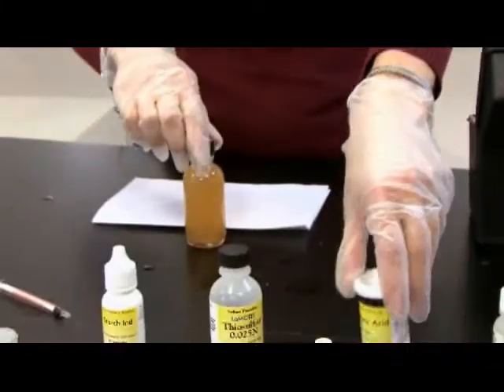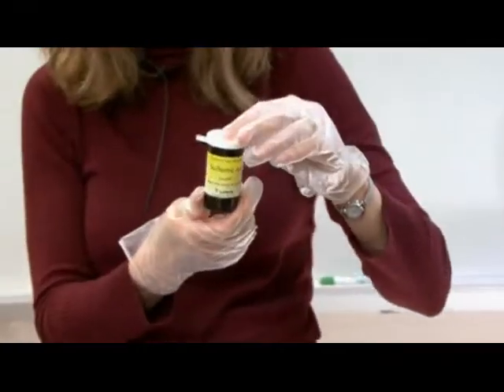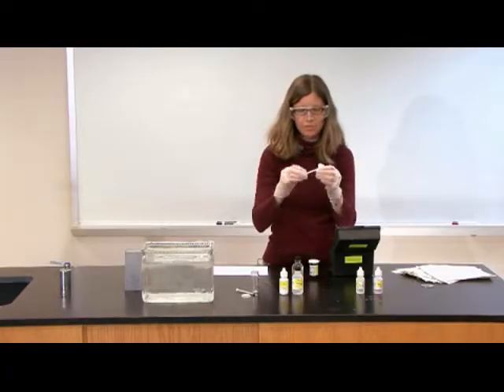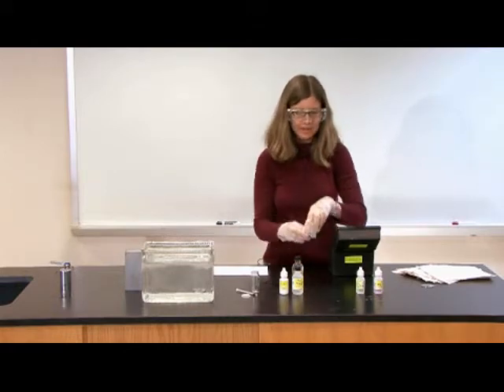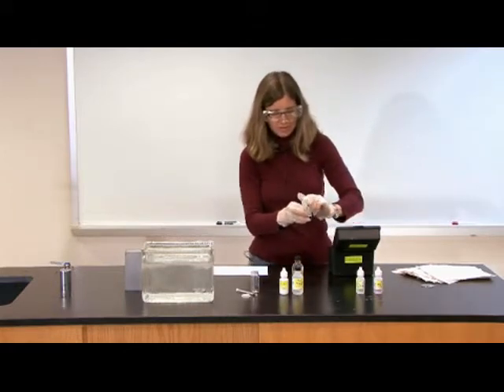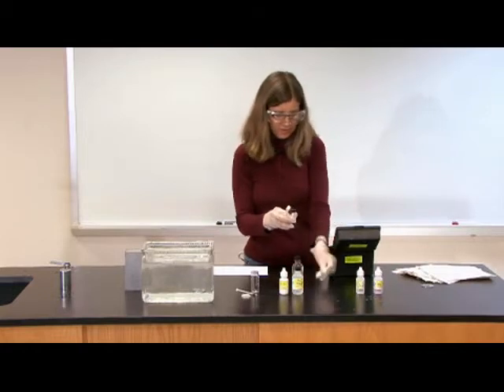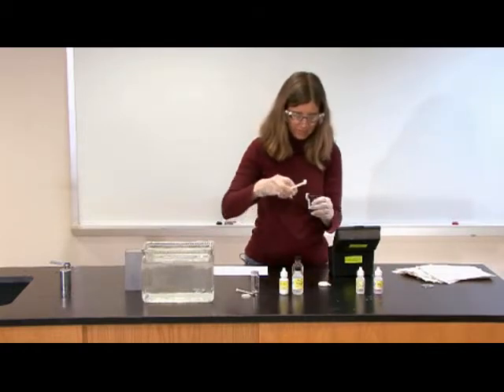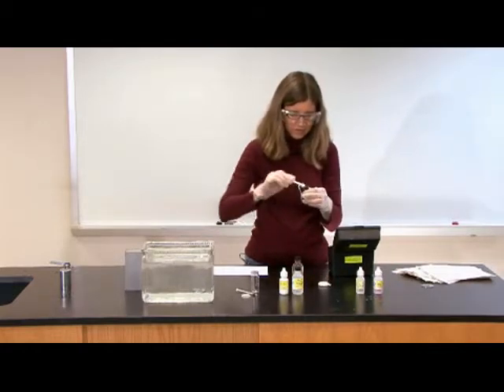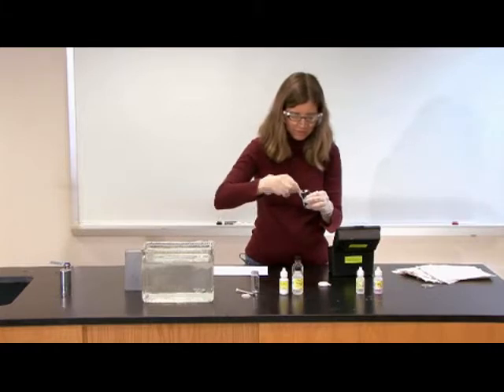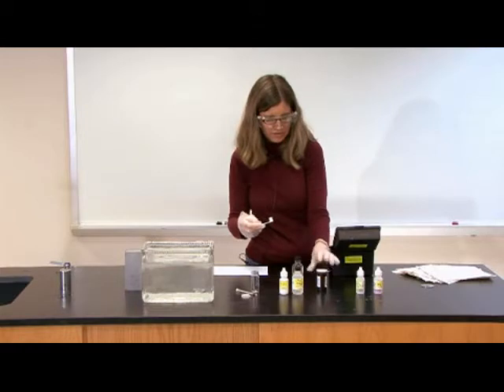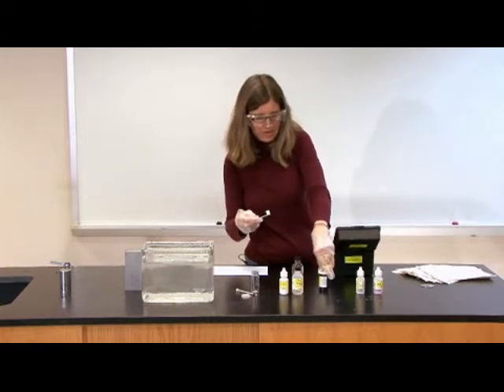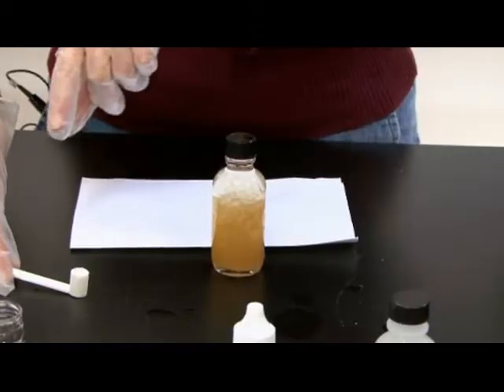Which is a sulfamic acid powder. And this spoon is actually designed to measure out exactly one gram, so you don't actually have to get out a balance and weigh it. So you open up the tube and get out one scoopful, which is one gram. And once again, students are usually skeptical that this amount of sulfamic acid powder is actually going to fit into your sampling bottle, but it actually will.